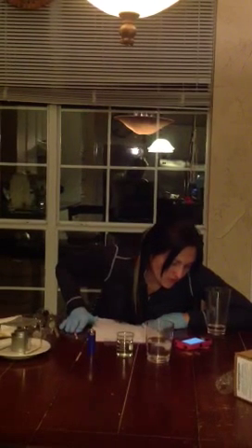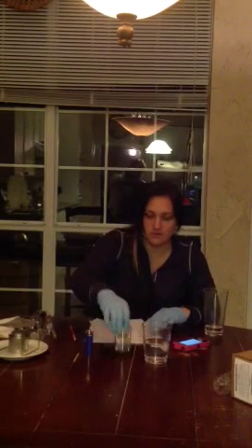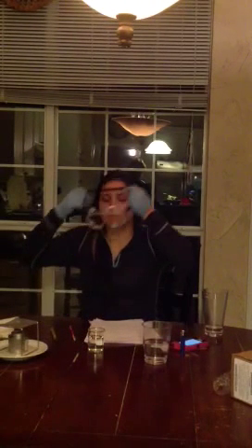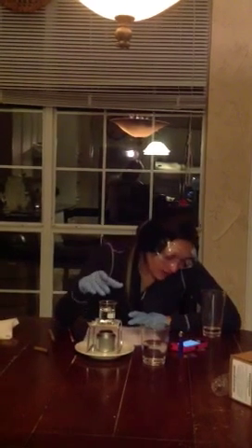Okay. So the next thing that we're going to do is place the beaker of water. This is the beaker, 100 milliliter beaker. Oh, I didn't put my goggles on. Onto the wire rack, gauze burner stand, and put on the safety glasses, which I've already done. And we're going to take this cap off of the burner fuel.